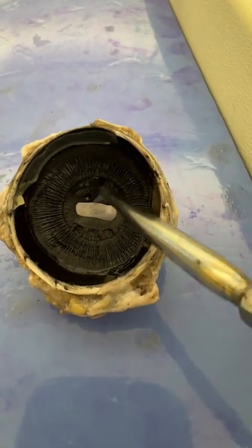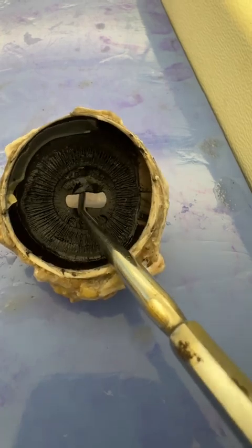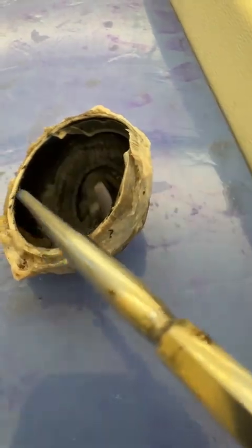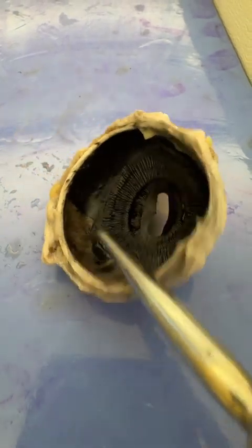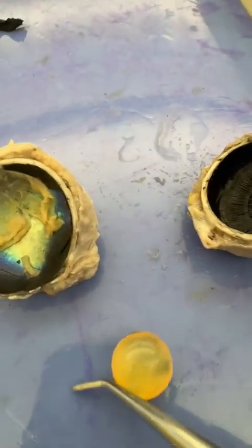So you can kind of see from here, the hole is the pupil. This part right here is the colorful part of the eye. That is the iris. Then we have the ciliary body. Look how dark it is right here. That is some of the darkest black you'll find in nature. That is the choroid. It's helping to focus the light towards the back of the eye. And we have the lens, that little guy.